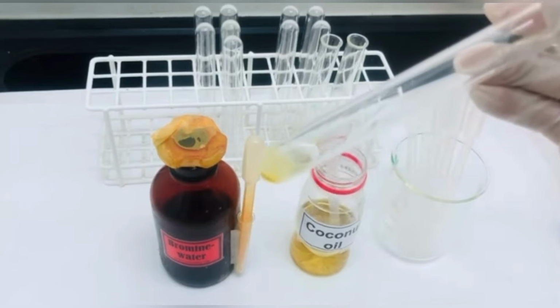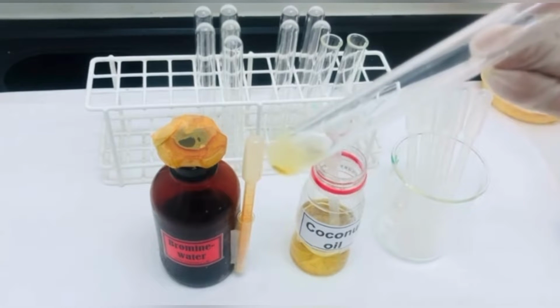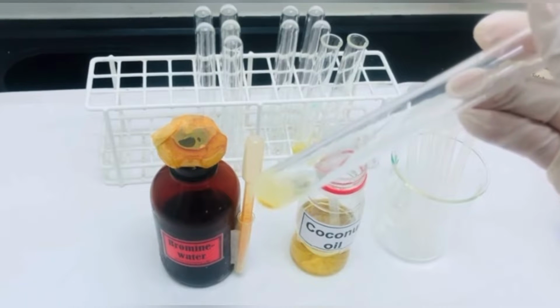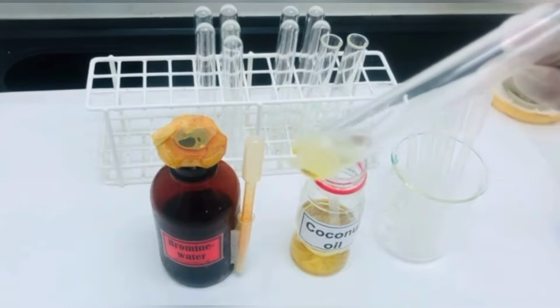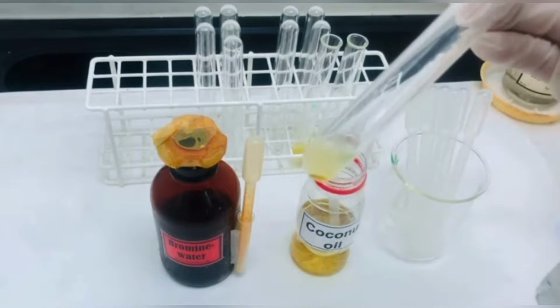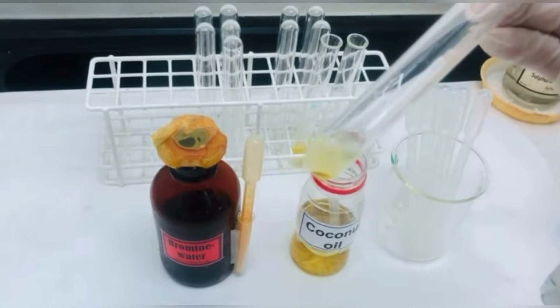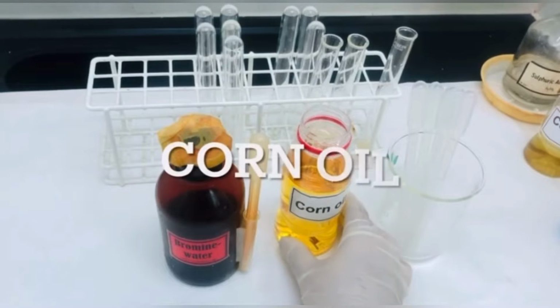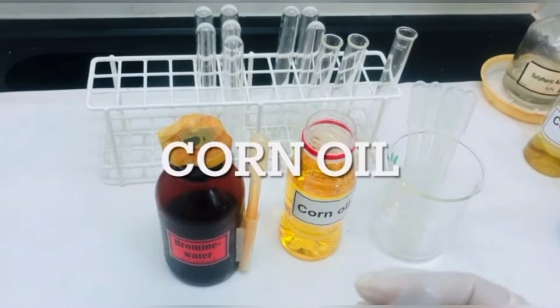Coconut oil has a mix of saturated and unsaturated acids. In fact, the percentage of saturated acids is very high in coconut oil, and hence the color is taking more time to disappear.